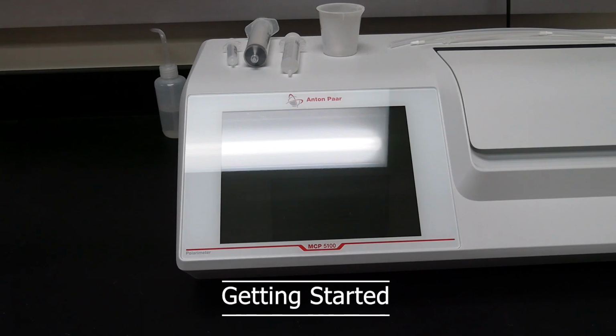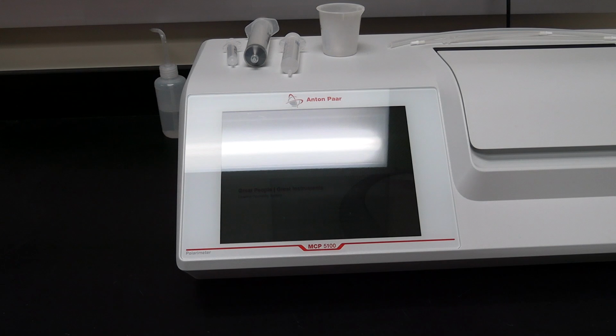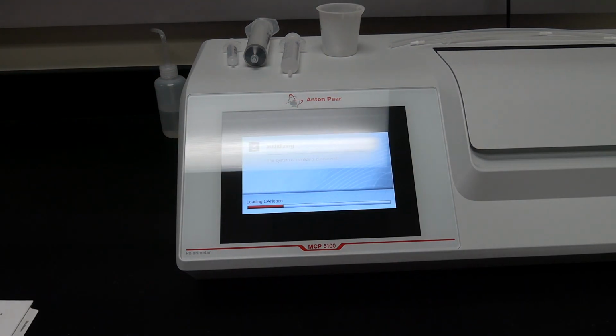Getting started. Flip the power switch on the back of the instrument. The display will turn on and the instrument will take a few minutes to initialize.